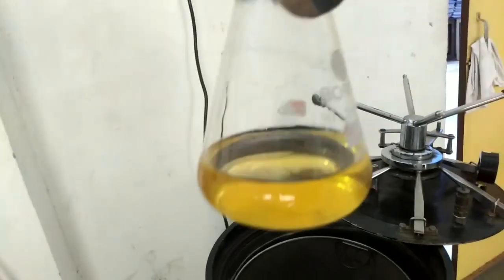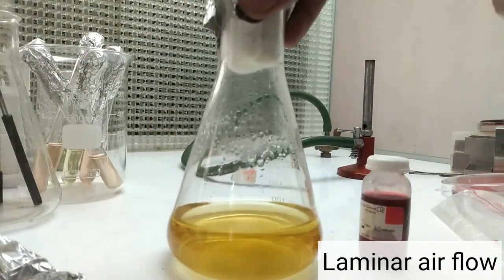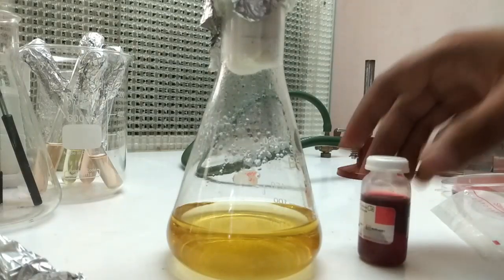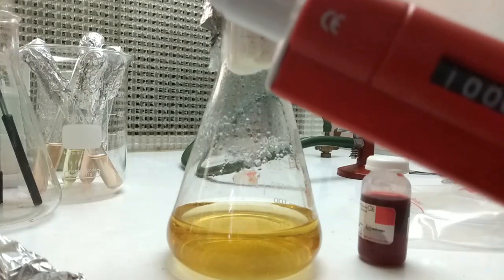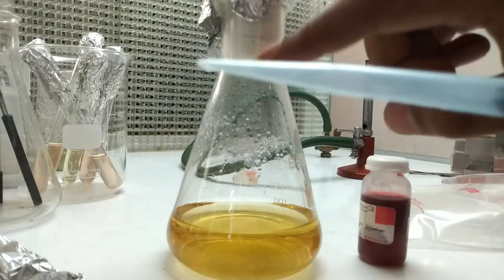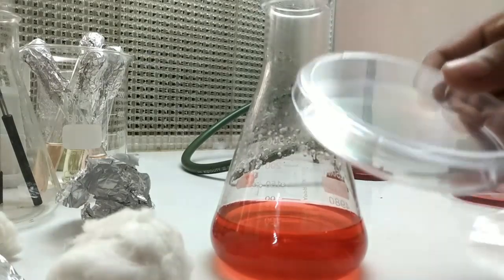The autoclaved blood agar must be cooled to 45 to 50 degrees Celsius before proceeding — you can check this by touching the flask. Then, inside the laminar air flow, take the mammalian blood sample and set the micropipette to 1000 µl. Add 5 ml of blood into the cooled blood agar so it becomes a properly composed blood agar, then pour it into a sterilized petri plate. That's all about blood agar.